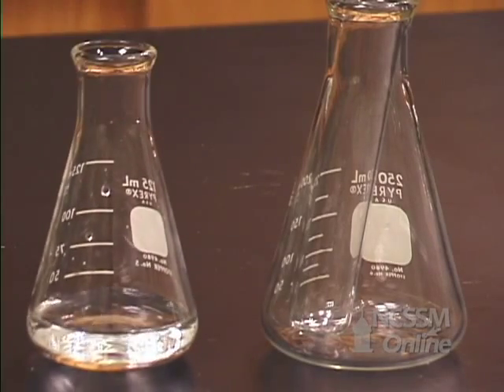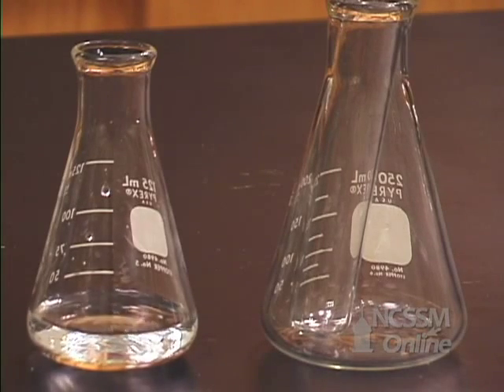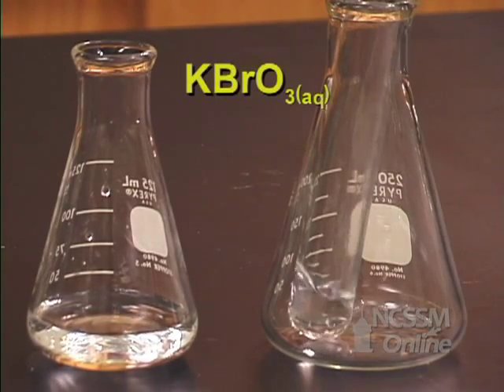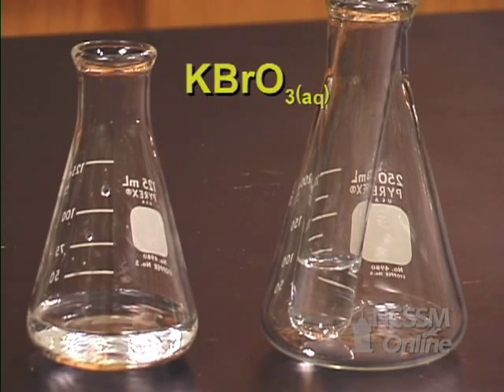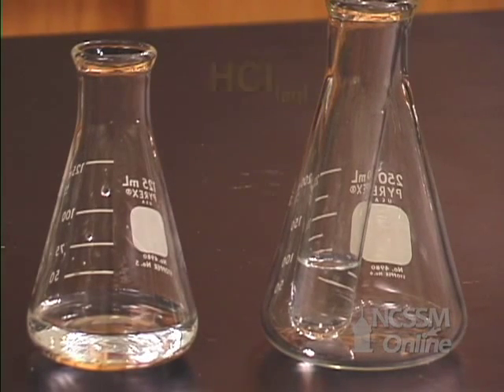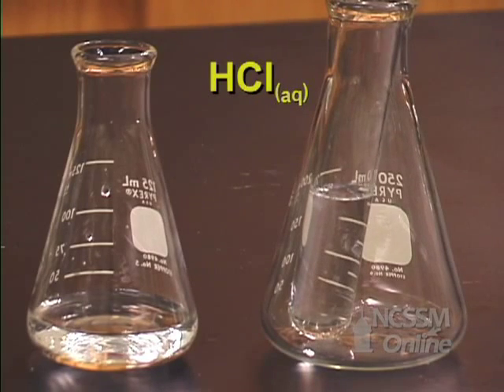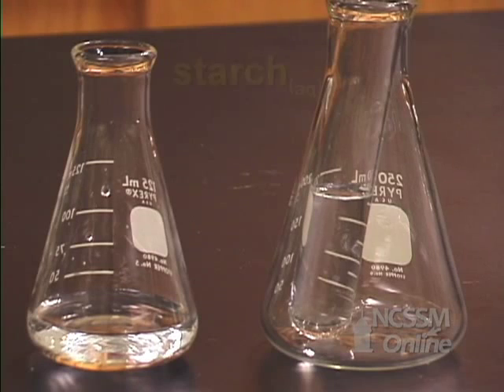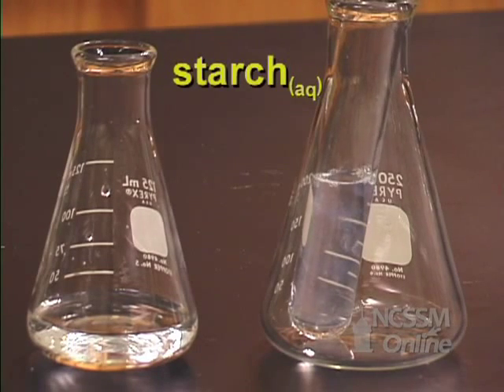In the test tube, we will add 10 milliliters of potassium bromate solution, 10 milliliters of a hydrochloric acid solution, and about one milliliter of a starch solution.